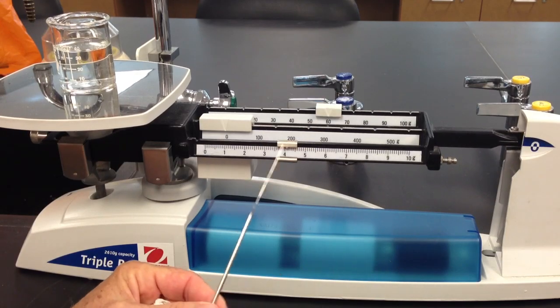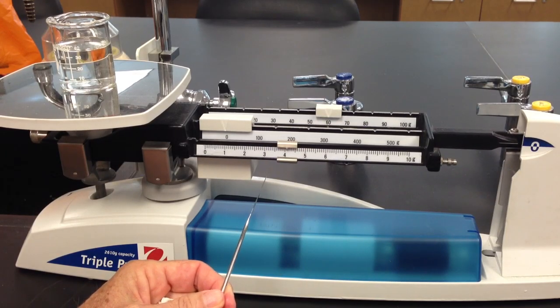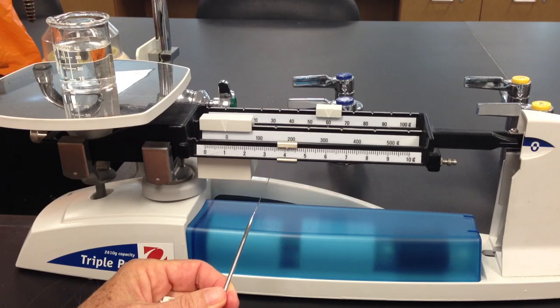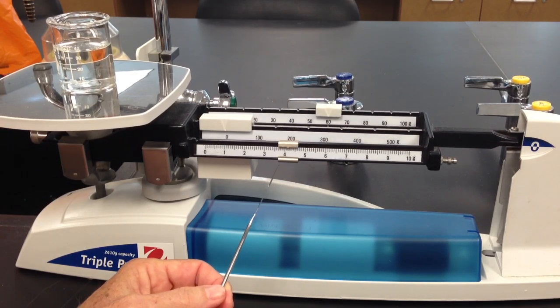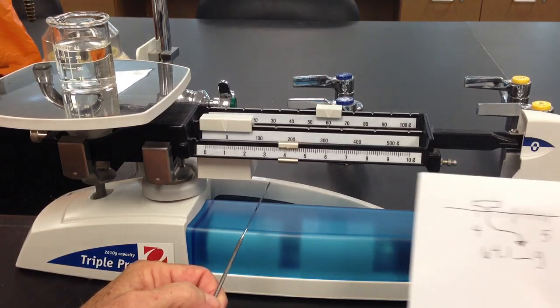We're getting to our zero point, and you've got to very gently move the beam until you get it right on the zero mark.